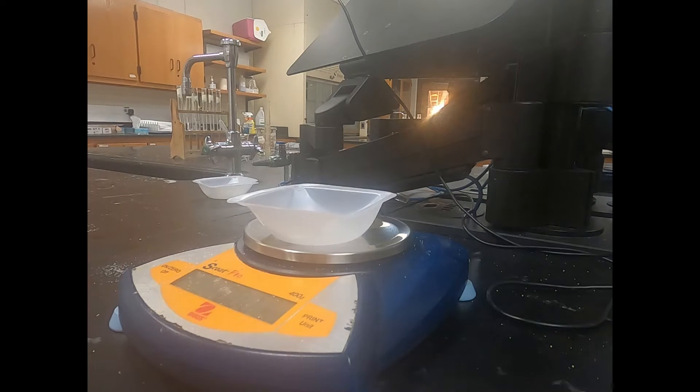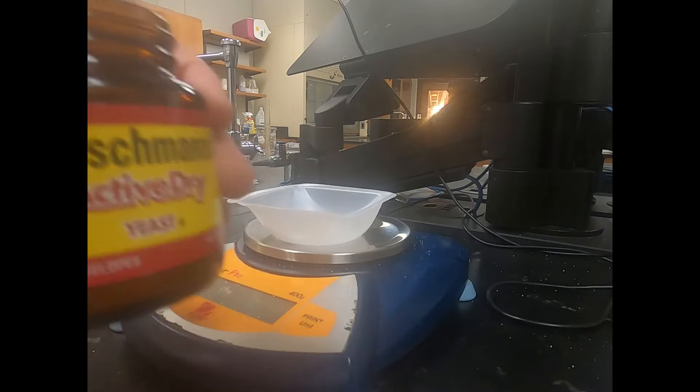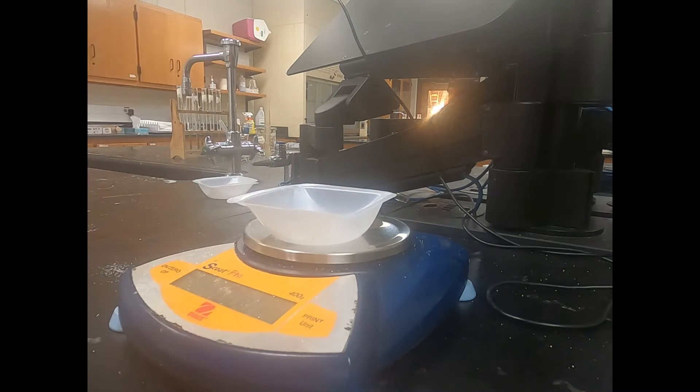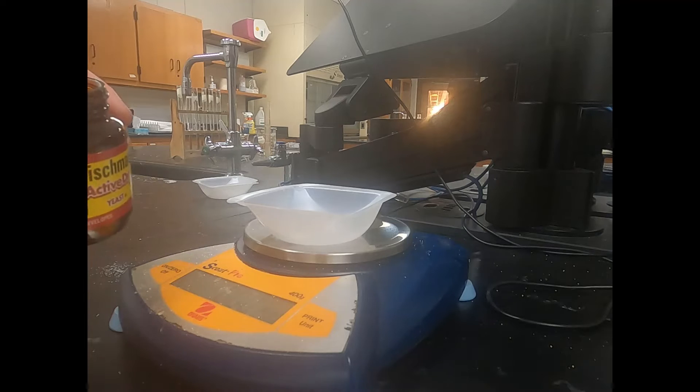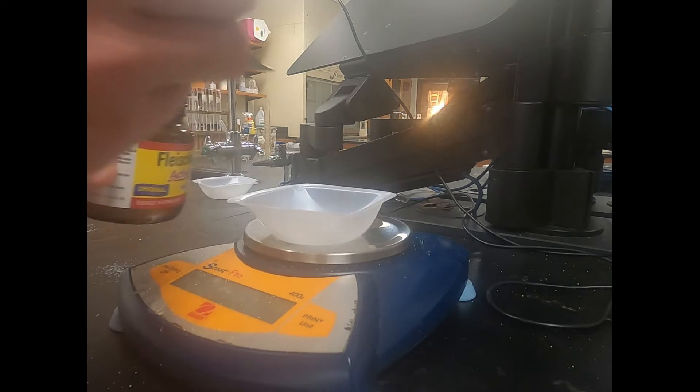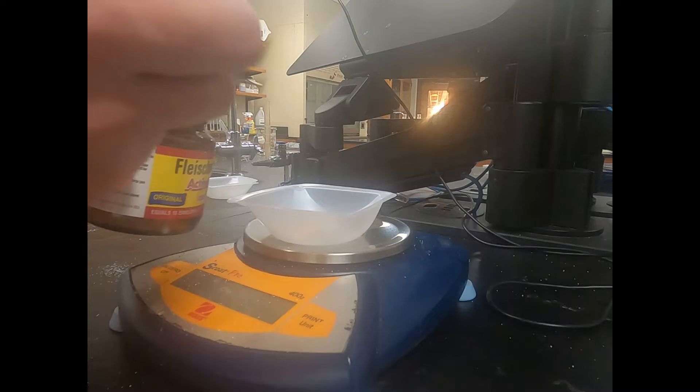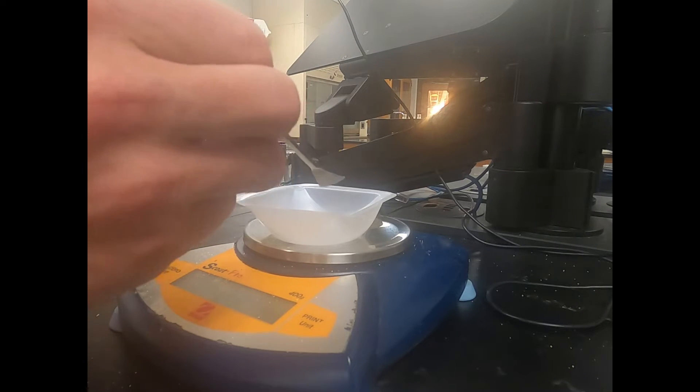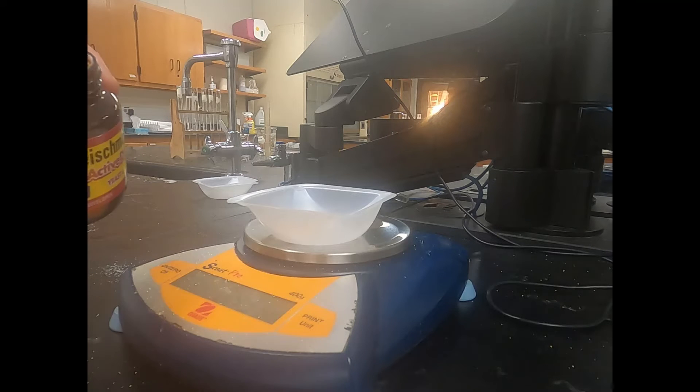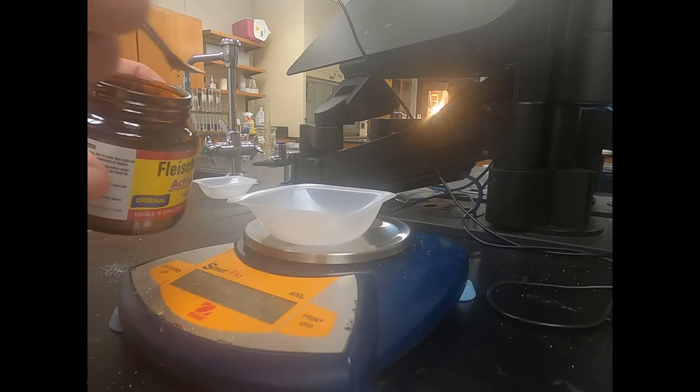In our next step we're going to be weighing out 0.8 grams of yeast. We have our yeast here, it comes in a glass jar or sometimes in little packets and we just want to weigh out 0.8 grams. Yeast is a fungus. It's able to go through respiration, both aerobic respiration and anaerobic respiration or what's called fermentation.